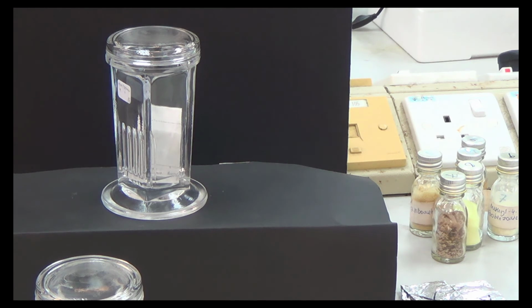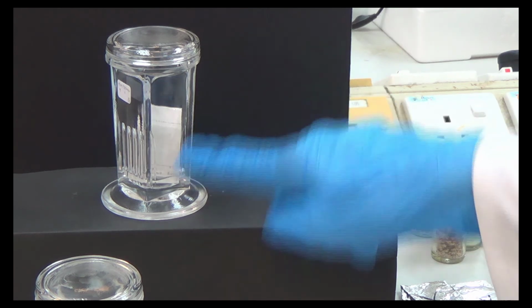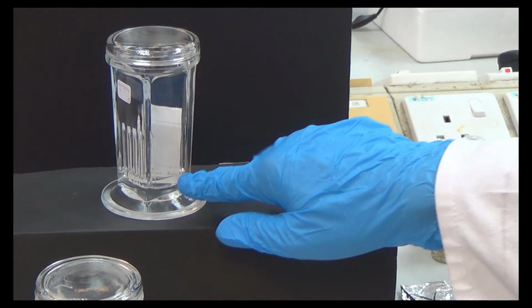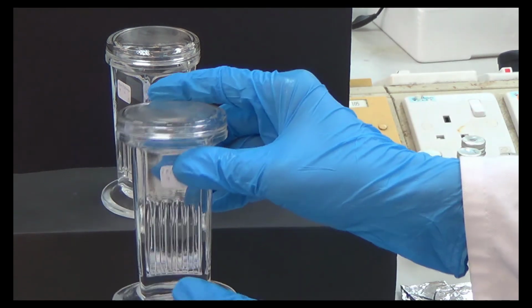Sir, can I try? Yeah. What's your name? Mariam. Mariam. Yeah. Because polar compounds dissolve in polar solvents and non-polar compounds dissolve in non-polar solvents. Okay, but here we don't say this is polar or non-polar. They just have some polarity. Meaning that this solvent is not totally polar, not totally non-polar, because we mix polar and non-polar. Same with this one, we mix polar and non-polar.